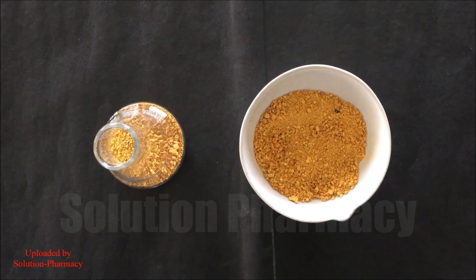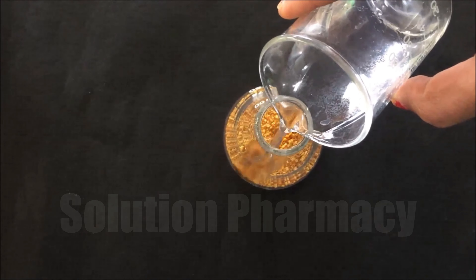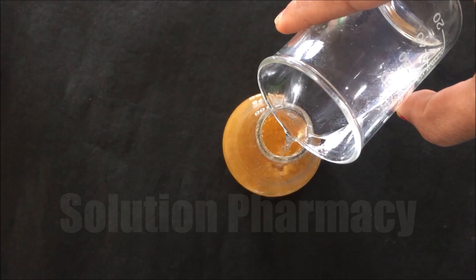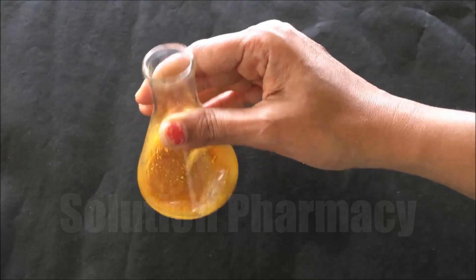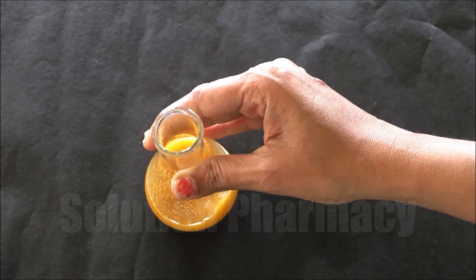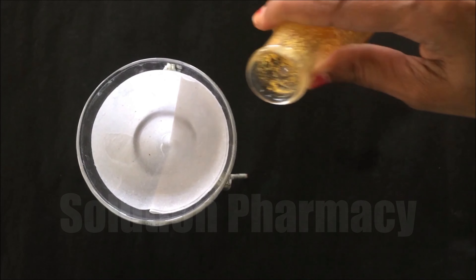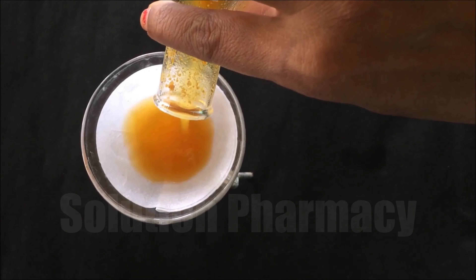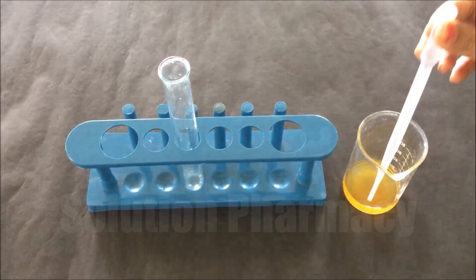Next is the chemical identification test for flavonoids. The first test is the Shinoda test. We have taken orange peel powder for the detection of flavonoids. Transfer a small amount of orange peel powder into a conical flask and add 95% ethanol for preparation of the ethanolic extract. Shake the conical flask to mix completely, cover with a cork, and leave for about 30 minutes for extraction. After 30 minutes, filter through normal filter paper and collect the filtrate into a beaker.